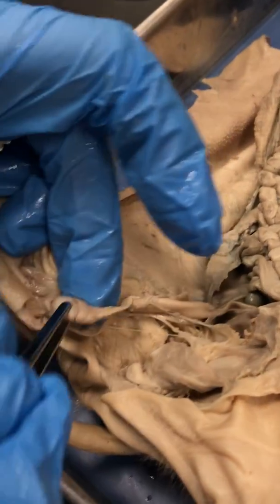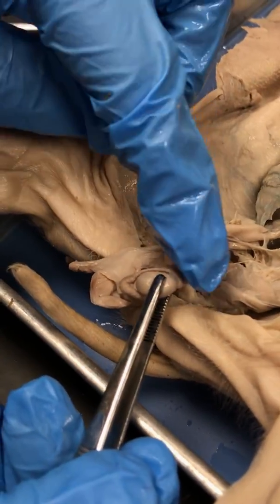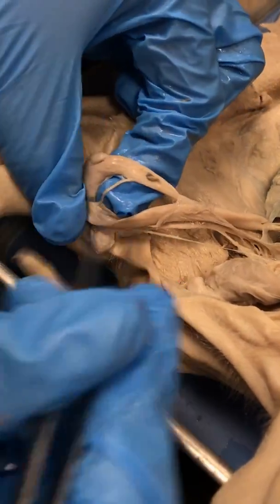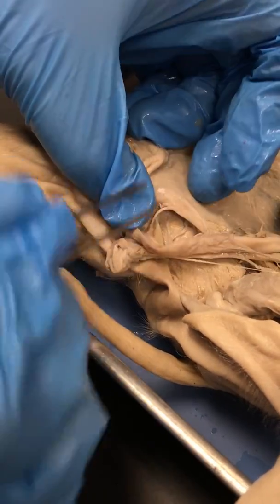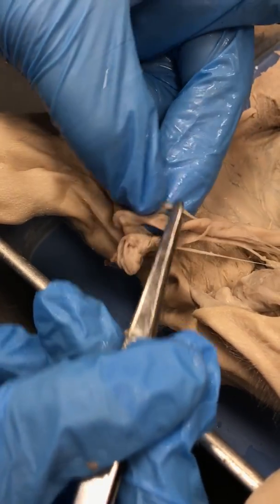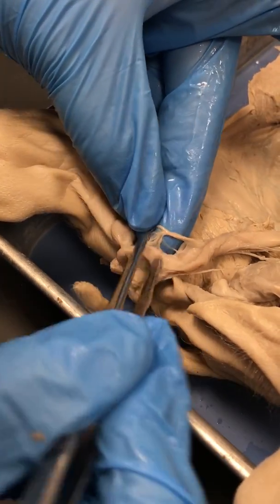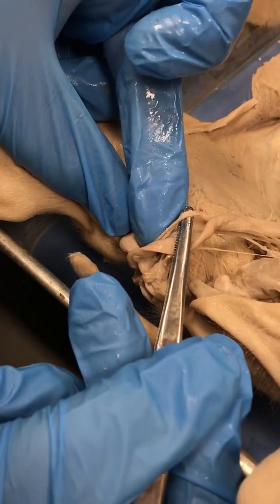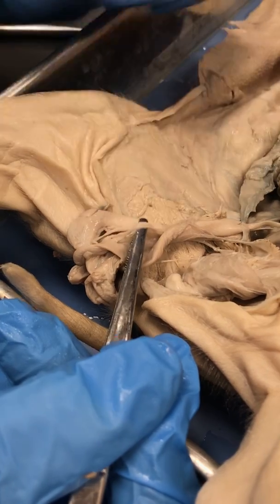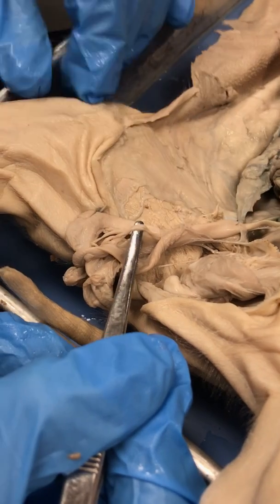And then if we look at the base of our epididymis, your sperm is produced in the testicle. It's excreted into the epididymis where it is finalized, and then it comes out of the epididymis as fertile sperm ready to exit the body. And if you look, you've got a thin little tube. This thin tube is important. His name is the vas deferens, and you can see him right here. He exits out right there, and he's going to come up and join with the urethra at the level of the prostate. So that is going to be your male reproductive anatomy.